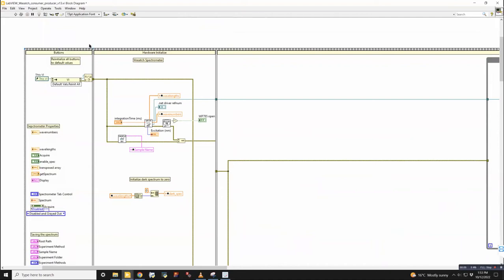A sequence structure will take this frame over here, execute everything in it, and then once it's done, move into the next frame and the next frame and the next frame after that. So the first one is all buttons, but it has this thing here, which I want to execute before anything happens. All this does is it refers to this VI and it reinitializes every button to its default setting. So nothing from the previous time that you ran the software will carry over into the current session.